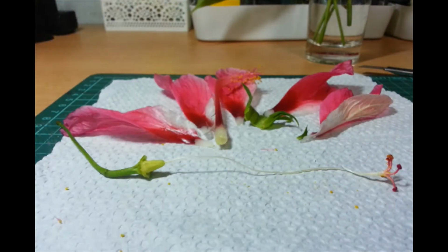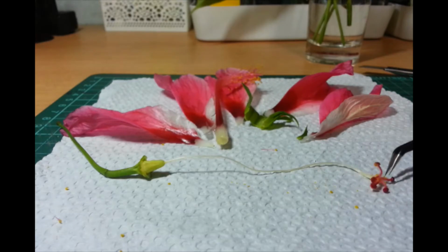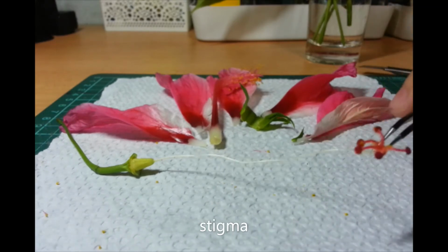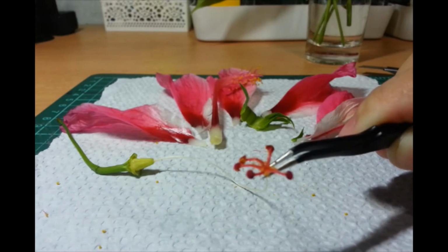Right. So, this is the female part. So, you have this sort of head part then. Might mistake it for yung male part. Kasi meron na siyang pollen. This is the stigma. Okay? So, yan, sa tuktok niyan, may parang, diba? May flat surface.